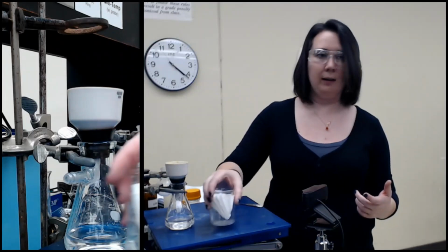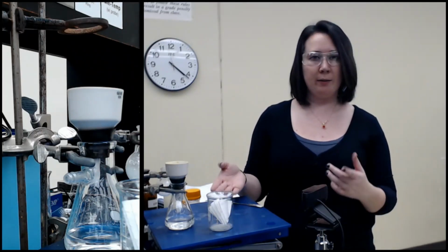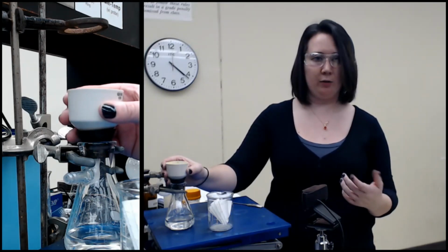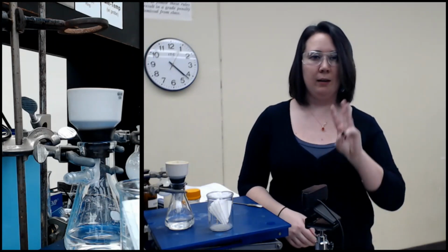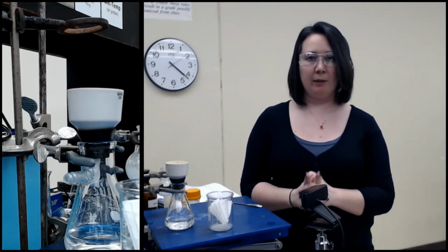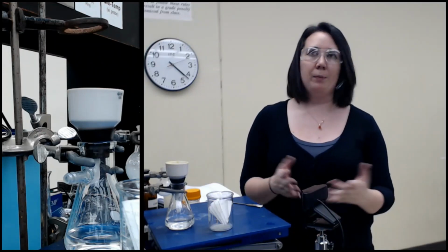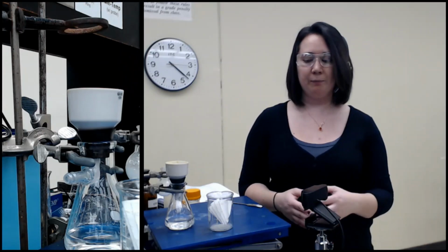This solid I had neutralized with the HCl, and a solid formed. I did vacuum filtration to collect it. So we've got 3 solids. That means we're going to see 3 masses and 3 melting points. And you're going to be able to use the masses to calculate the percent recovery and percent composition of the initial mixture.